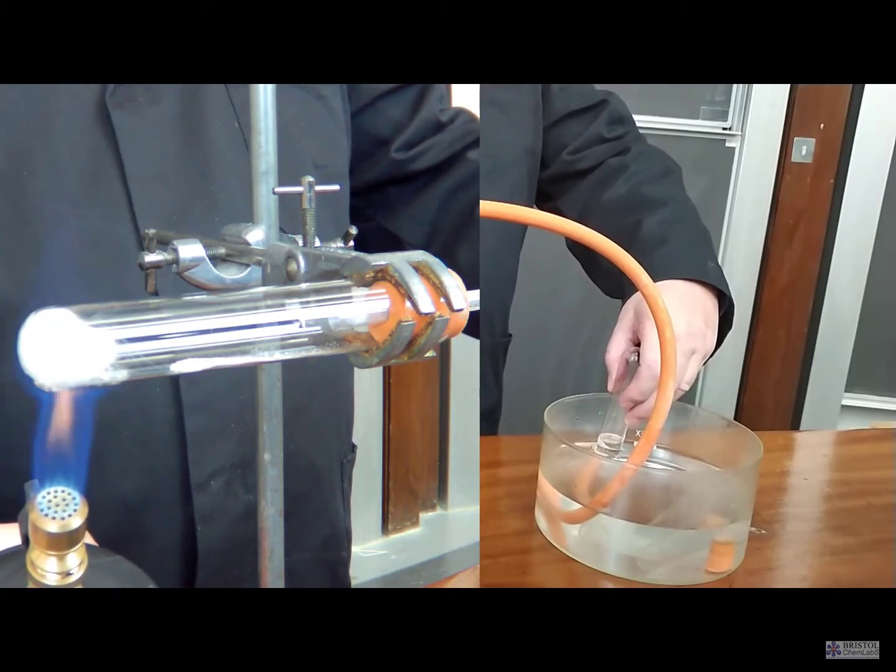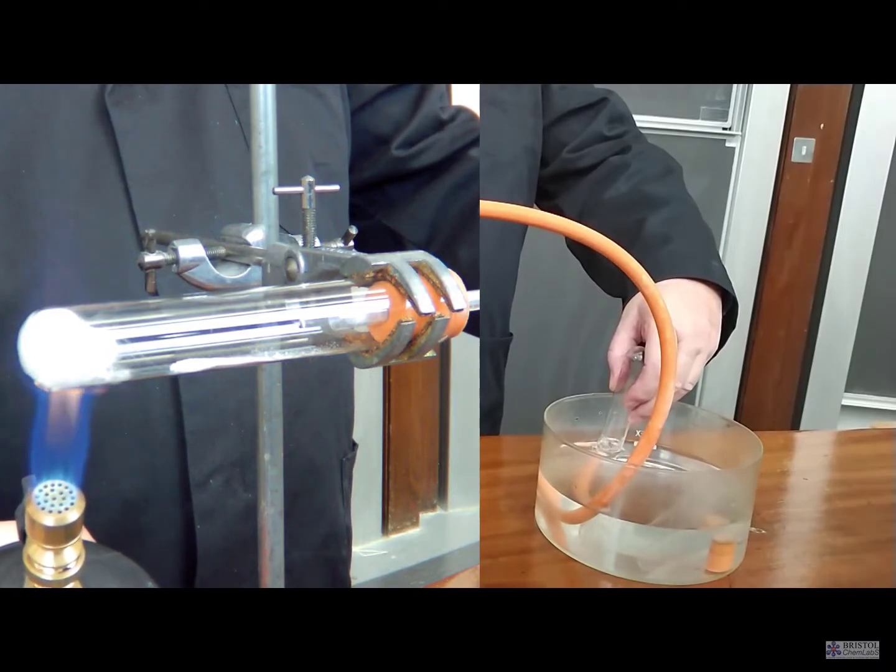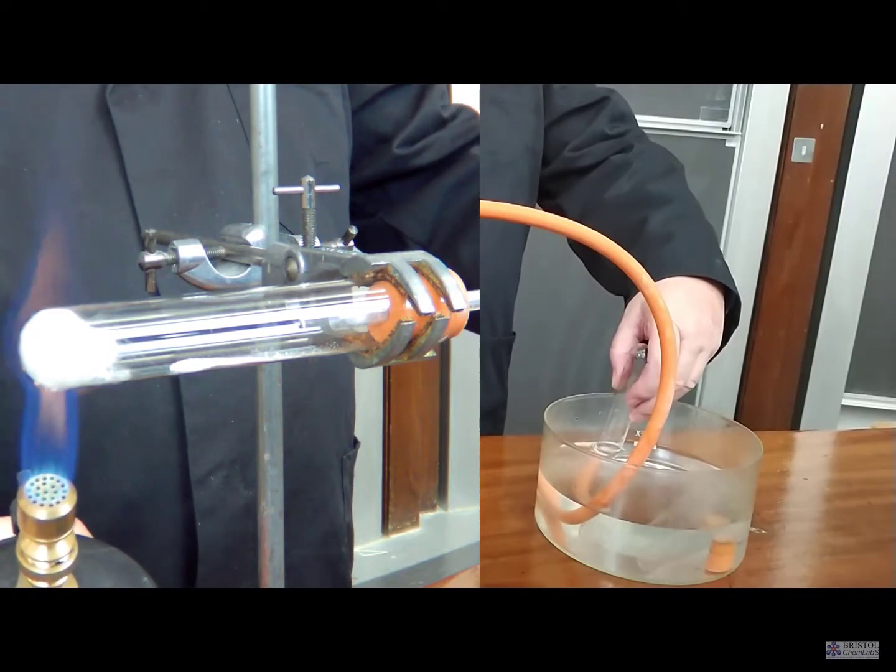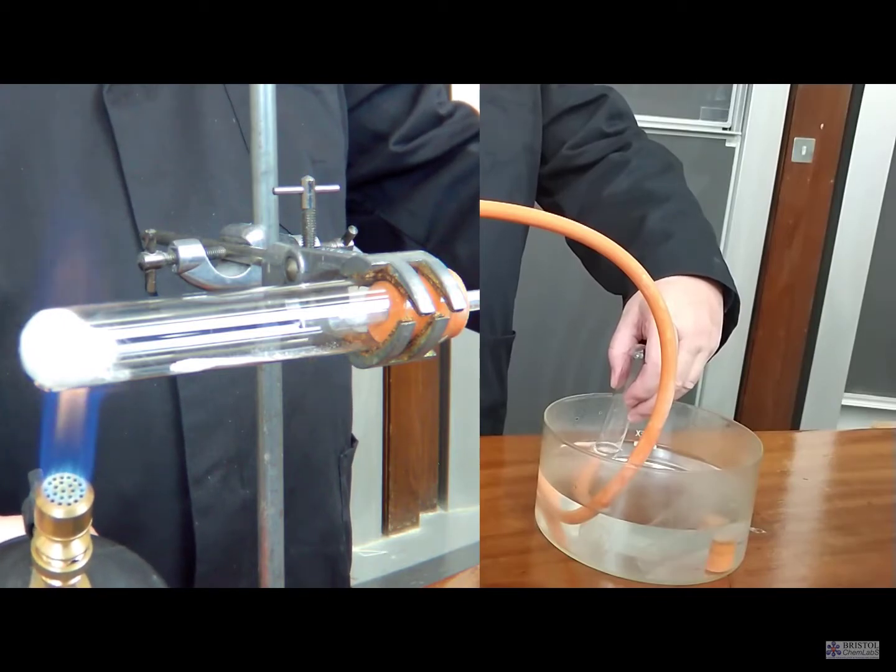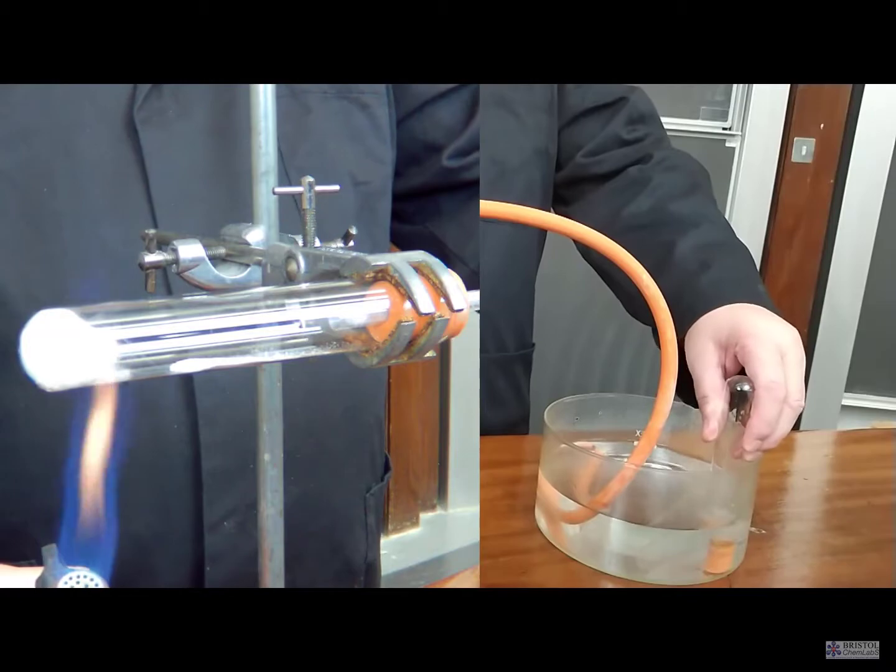Collect the gas by the downward displacement of water. Stopper the tube and collect as many as you can. As we're using boiling tubes here, rather than test tubes, we're not going to collect as many as you would.